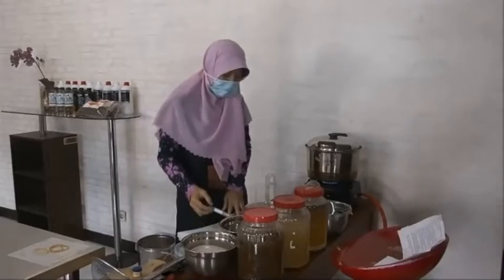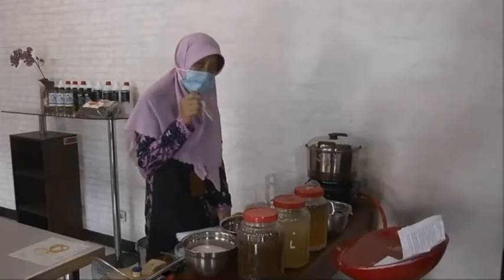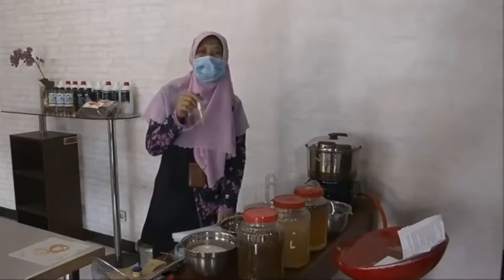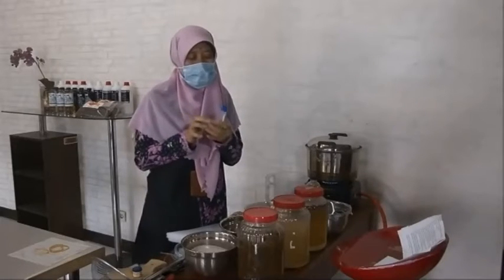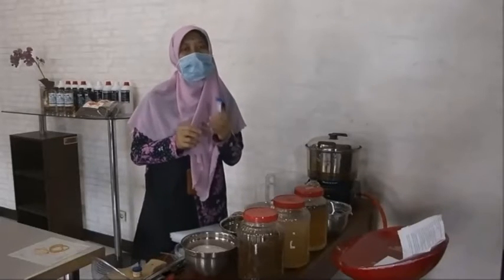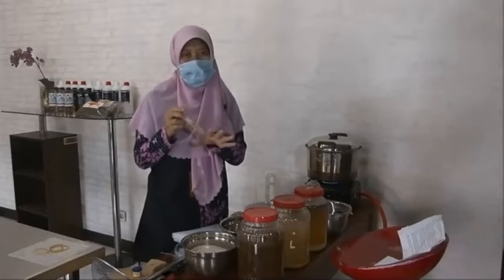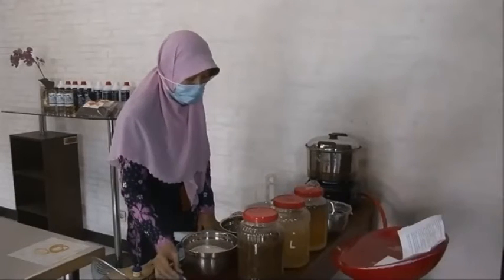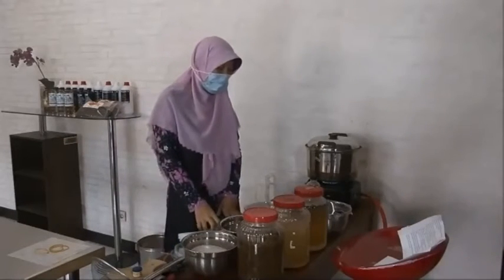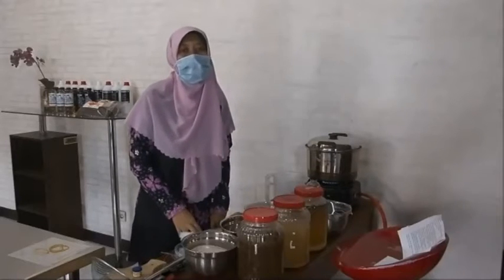And then after we have the isolate, we have to know the isolate is correct. If we want to propagate Pseudomonas fluorescens, we have to know that the isolate is correct. And then after we have the isolate set aside, we have to make the liquid medium for the growth of bacteria.